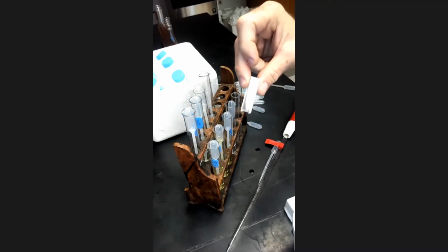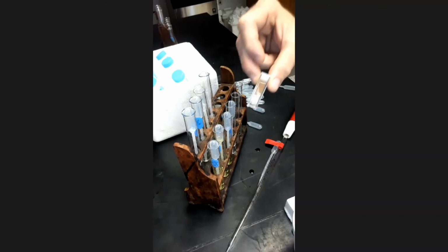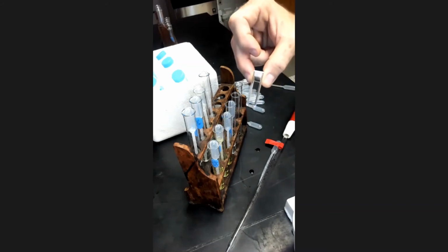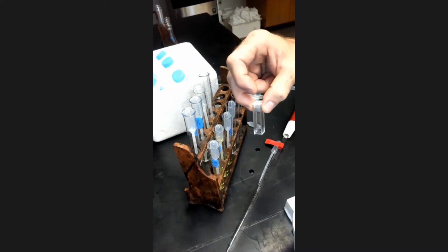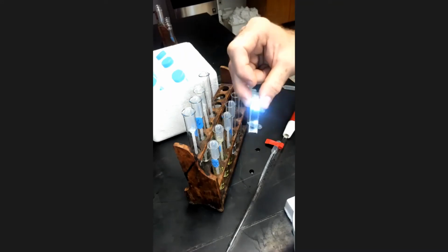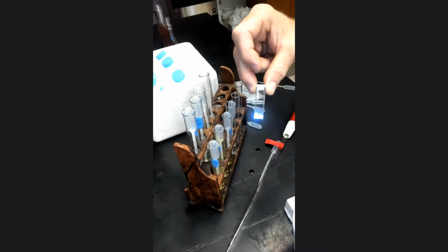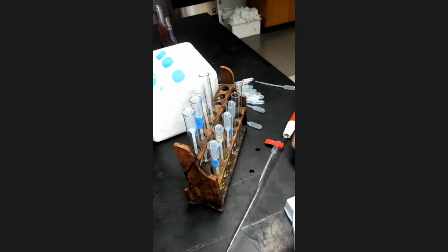When we line these up in the spectrophotometer, which is the device that will measure absorbance for us, we're going to need to make sure that the clear sides are lined up with the direction that the light shoots through. I'll show you that in a second. We also want to make sure that as we handle these cuvettes, we're only handling them by the ridge sides, so we're not getting a lot of fingerprints on the clear sides, which would affect the amount of light that can pass through. So what I will do is fill a cuvette for each of these samples.